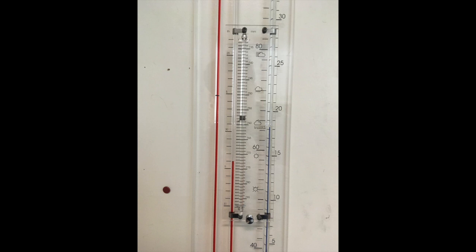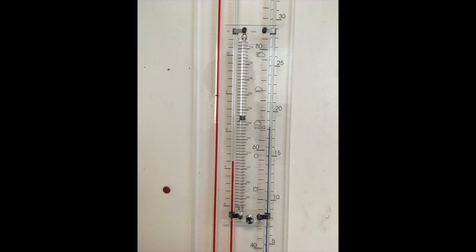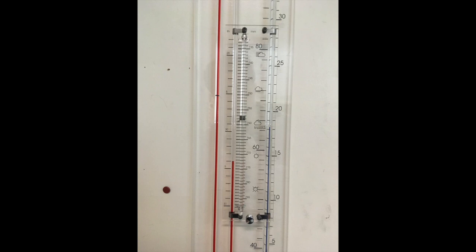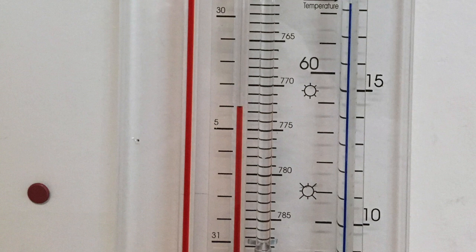The pressure pushes down from the atmosphere on the middle red tube, so we will read that pressure of the atmosphere going downwards. There are units of both inches and millimeters of mercury, and you should record your reading in millimeters of mercury. Keep in mind that we are reading downward, not upward, because the pressure from the atmosphere is coming from the top.